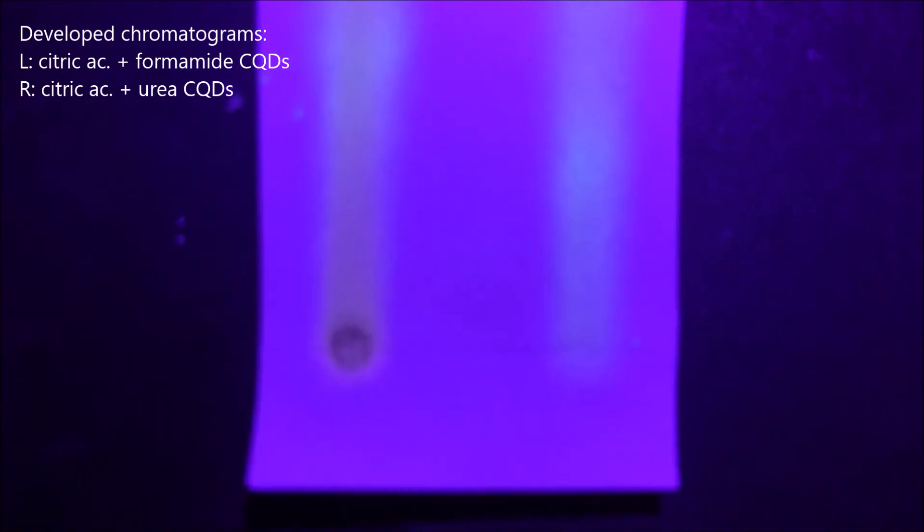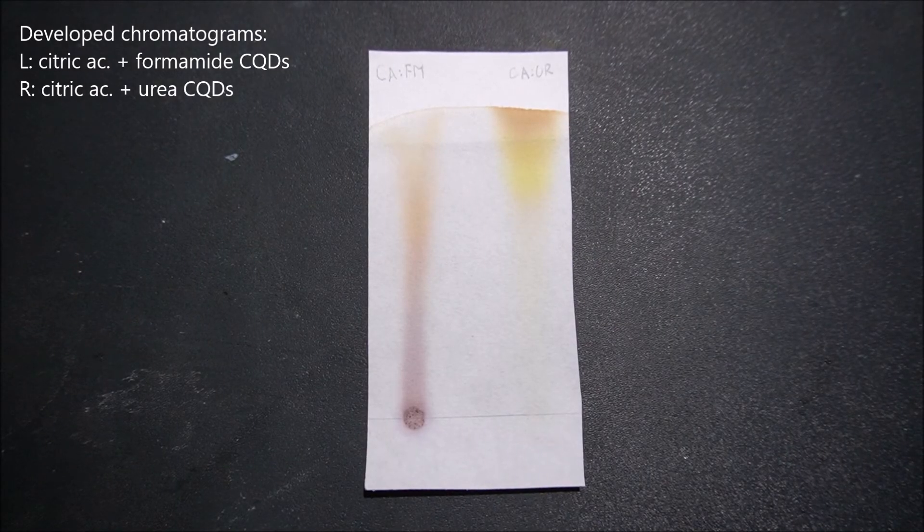These chromatograms are good enough for small-scale preparative work. The desired spot is cut out from the chromatogram and the carbon quantum dots are eluted with minimal amount of water.